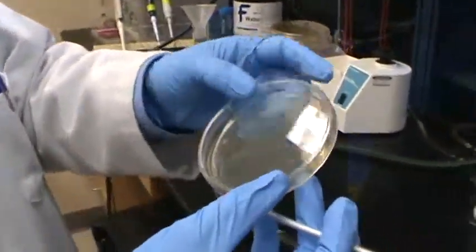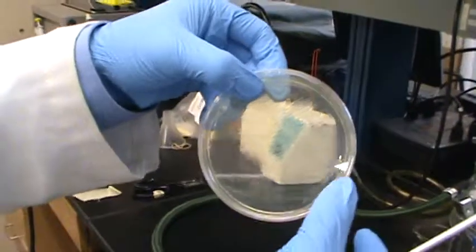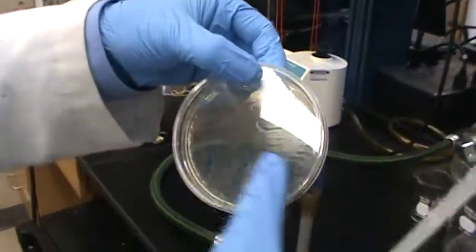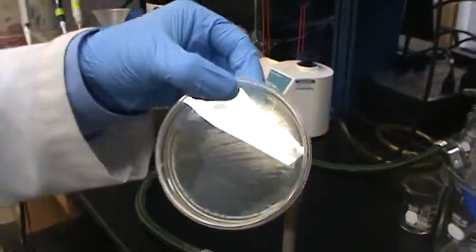If you can see: first, second, third, fourth, and then fifth all over the plate.